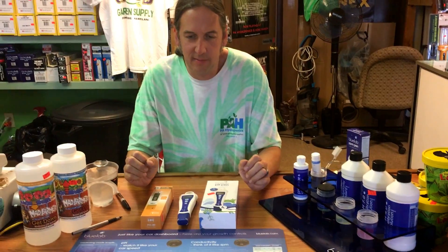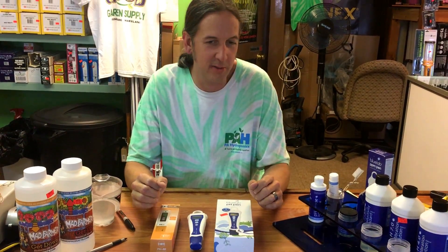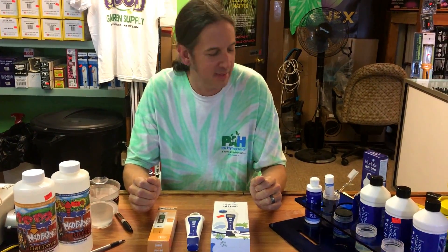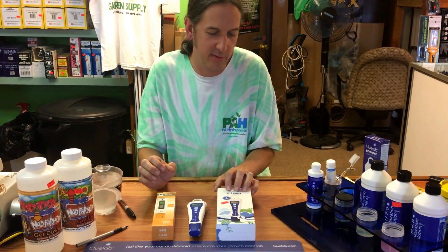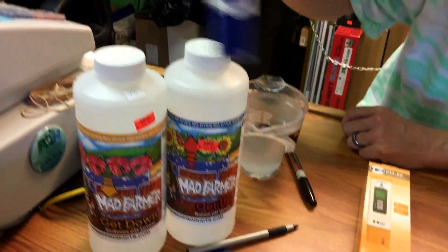The full pH range is 0 to 14 — 0 is pure acid, 14 is very alkaline, and both extremes are dangerous. Most meters read between 2.5 and about 10.5. This here is your pH up and pH down adjuster. Don't ever stick your meter directly into one of these bottles — it will mess the meter up pretty quickly.